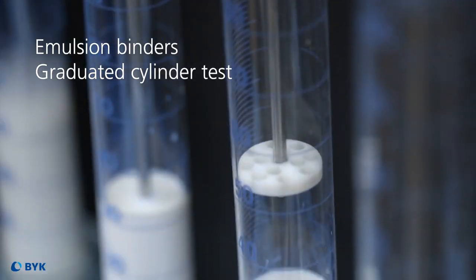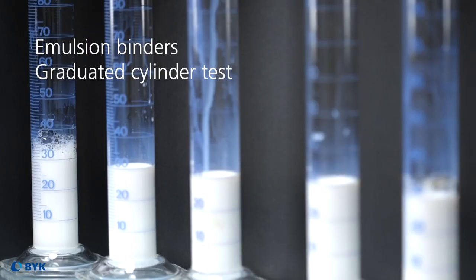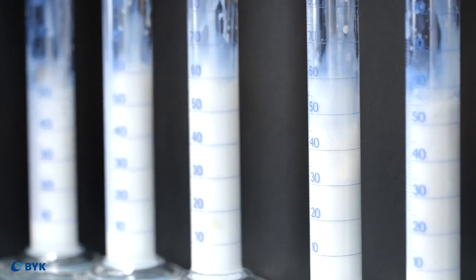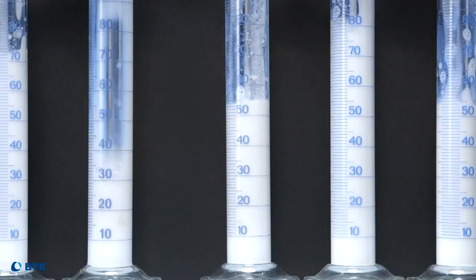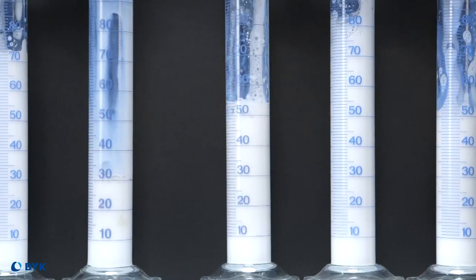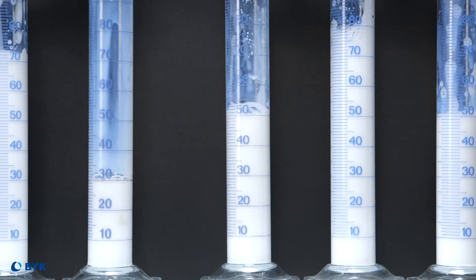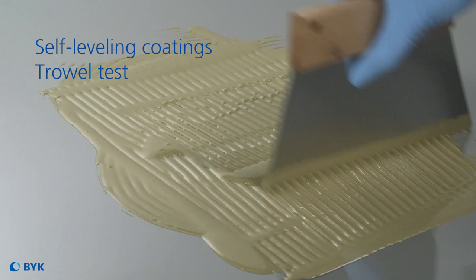We place the resin or paint into a cylinder. A disc with holes moves up and down in and out of the liquid for a certain amount of time. The volume of the resin or paint is measured as soon as the test is completed to calculate the volume of the introduced foam. We can also measure the density of the paint before and after the test and compare it with the control paint. For self-leveling floor coatings, we use a trowel test.